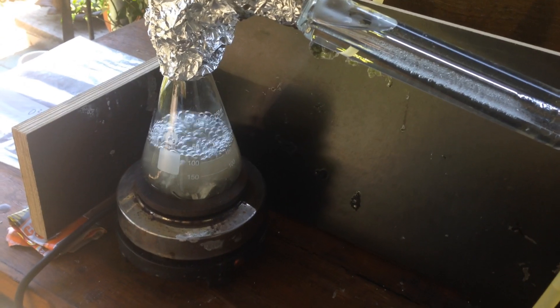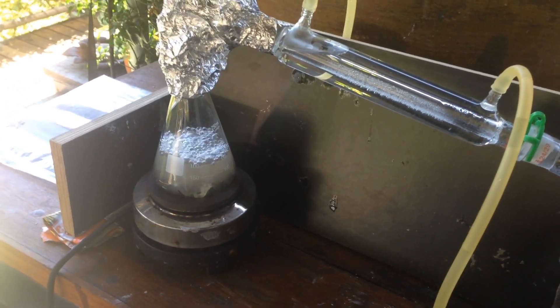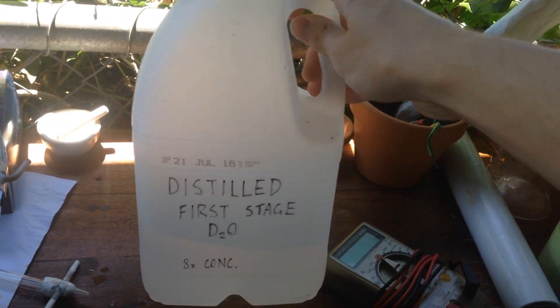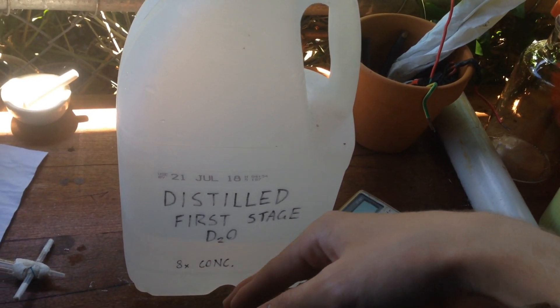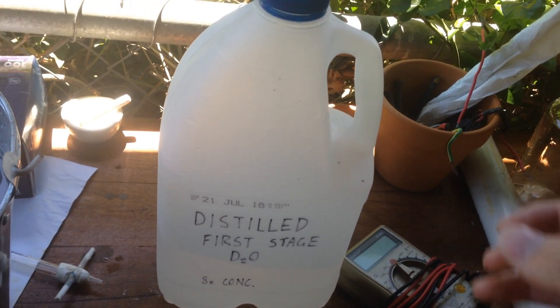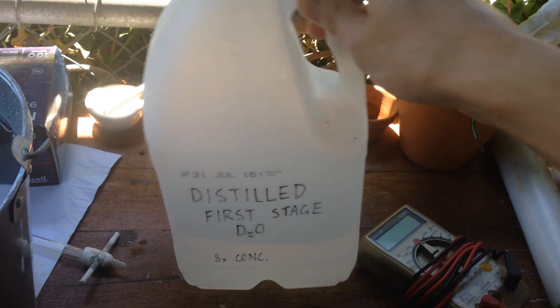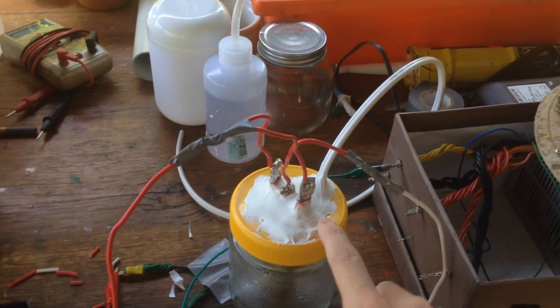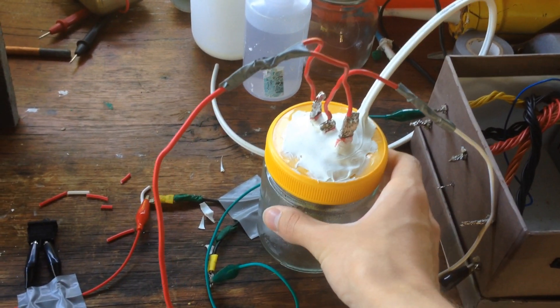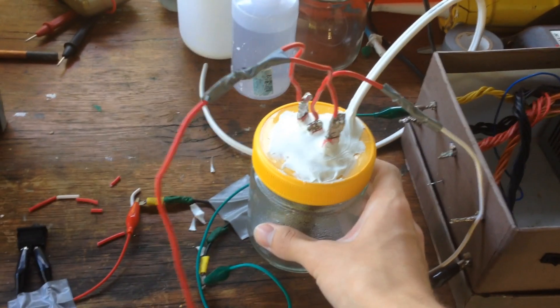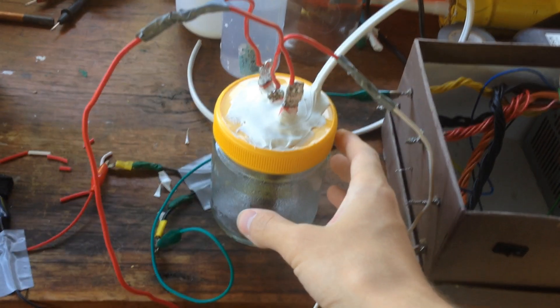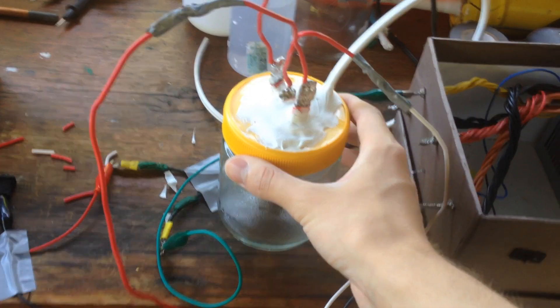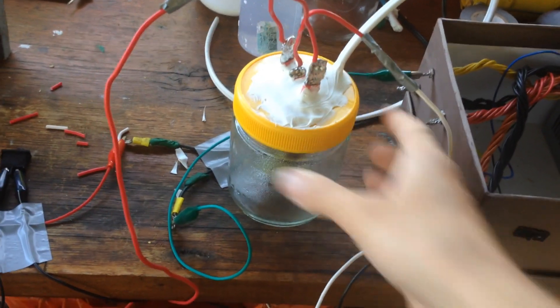So we're distilling our last bit of water. I think I'm going to end the video here, it's getting a little bit long. This is the last bit of water that we've got to distill, and that will finish off our distilled eight times concentrated, it's actually between four and eight times concentrated, we're being a bit optimistic by calling it eight times concentrated there, but we'll have finished off distilling all of that. I've also finished siliconing up the new electrolytic cell, so as soon as this finishes, I'll stick some of that in here and continue concentrating it down. This will probably take a little bit over a month to fully concentrate down, and then I'll get back to you with a part three. So till then, catch you next time.